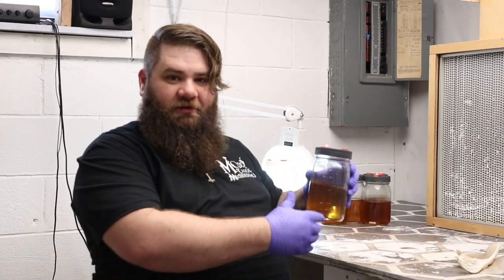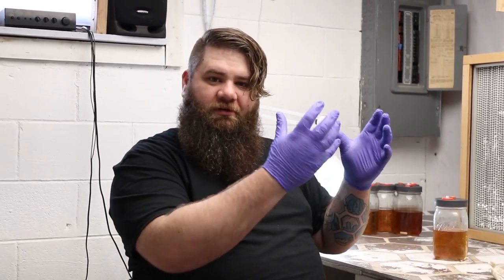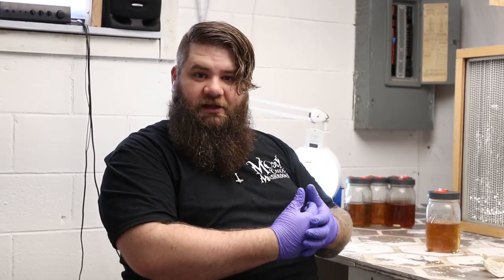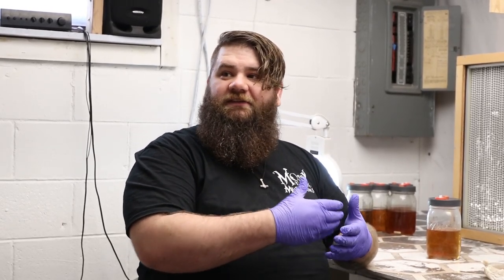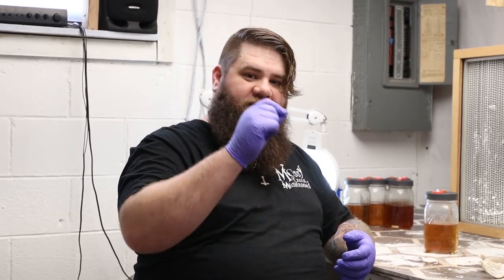Once this is grown in with your tissue and all the mycelium, which will look a lot like a jellyfish, you'll do a couple of things. One is hold it up to a light source — if you can see through it, except where your jellyfish-looking mycelium is growing, it should be pretty clear. If it's cloudy or milky looking, it's probably contaminated. If it looks clean, you can test it in a bag of grain or on an agar dish to see if it is clean. If it's clean, you can take this and expand it to as many jars as you want. You've taken a mushroom — whether that be a wild mushroom or one from your grow room — and brought it into liquid culture with this very simple process of a needle biopsy straight into the jar, producing a massive amount of mycelium very quickly.